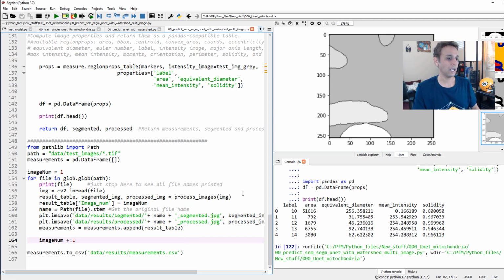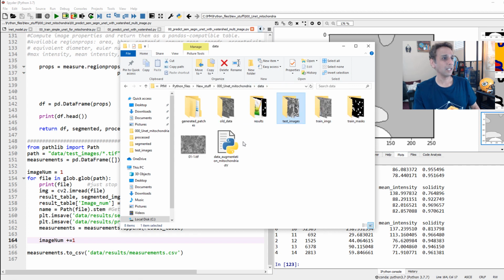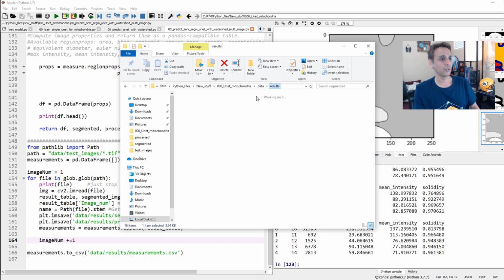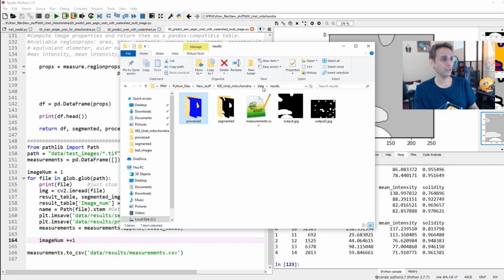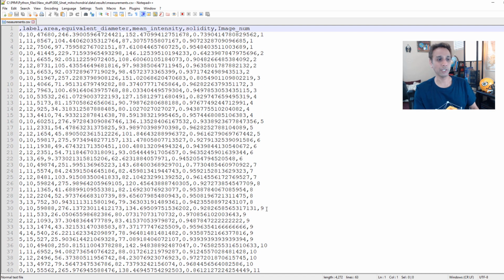It's fun to have a look at this. This should be pretty fast. There you go. Each image is being processed, and this is my test images. Let's go to results, segmented, and here is our segmented. You see, nicely separated, each of these. And let's go to our processed. There you go. Very nicely processed, as you can see. Nicely separated and processed. And did I save the results? Yeah, to measurements.csv. If I go to results, measurements.csv, there you go, from each of these, including the image number 1, 2, 3, 4, and so on.